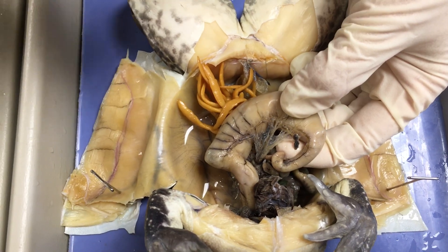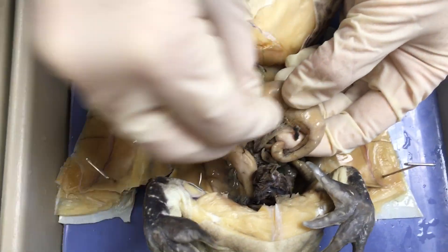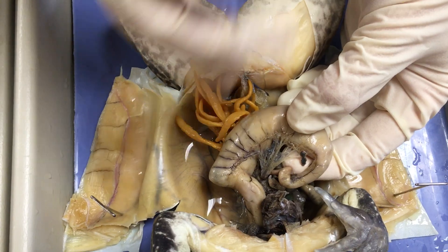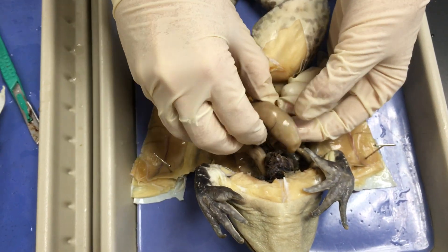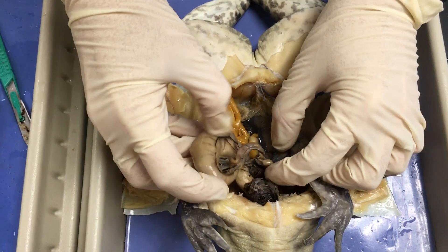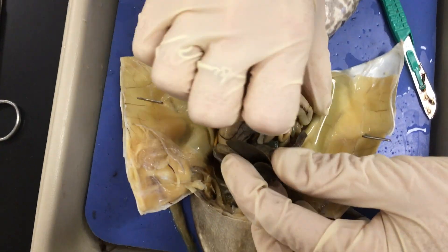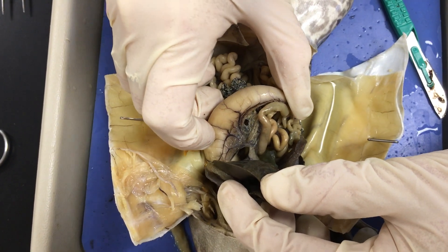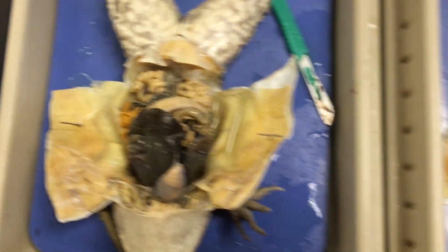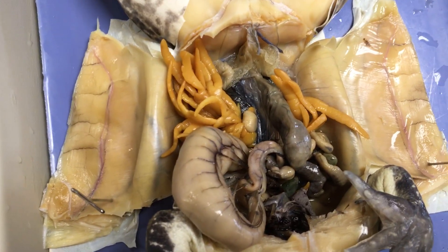We as humans have this same sphincter separating our stomach from our small intestine. It keeps all the acids and digestive juices in the stomach from getting into the rest of the digestive system — there's a muscle in there that can open and close, controlling what moves from the stomach into the small intestine. That next structure would be the small intestines connected here. All of the small tubing connected to the stomach is small intestine. Don't let the name confuse you — it's actually longer than the large intestine, but the diameter is small, which is why it's called the small intestine.